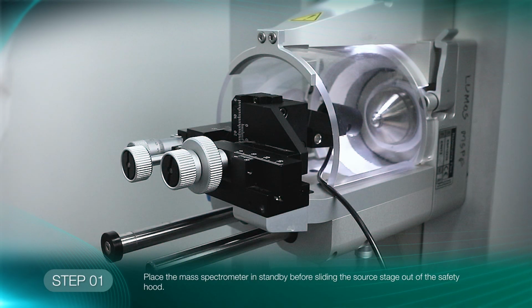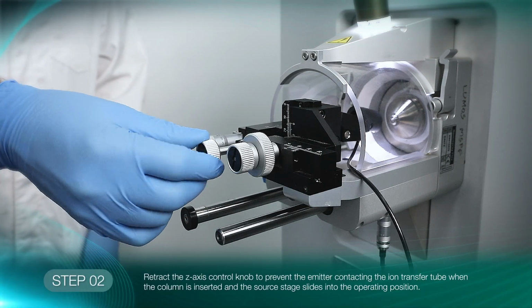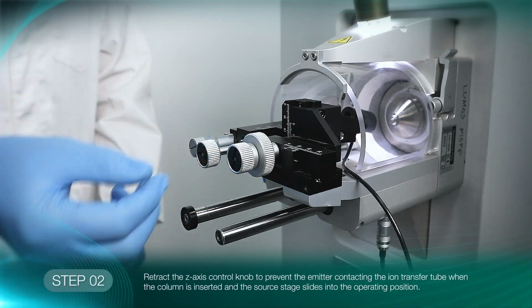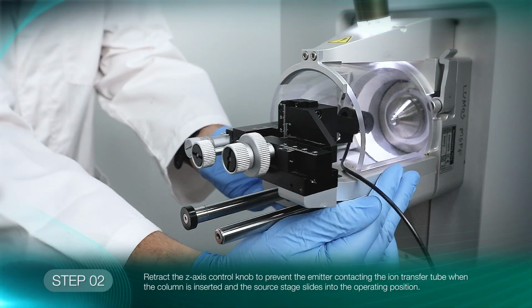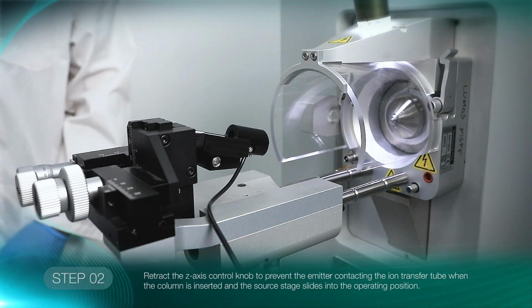Place the mass spectrometer in standby mode before sliding the source stage out of the safety hood. Retract the Z-axis control knob to prevent the emitter contacting the ion transfer tube when the column is inserted and the source stage slides into the operating position later in the process.